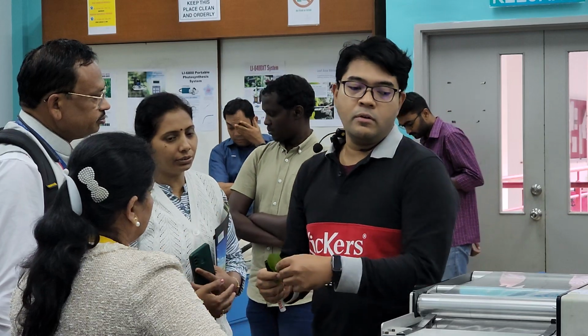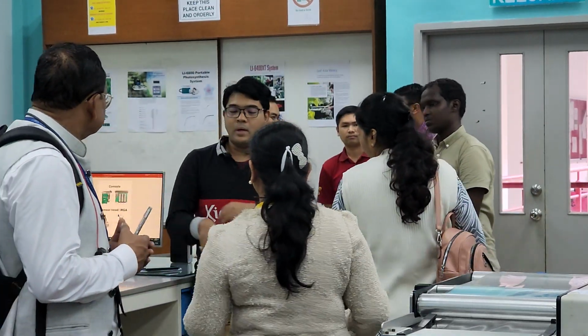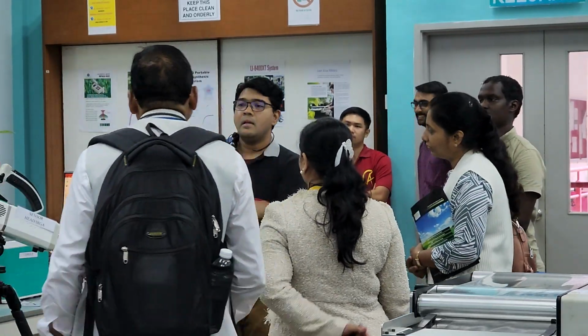In the newer version, they are detecting that yellow. There's a new version that actually detects the coloration and also the physical condition of the leaf. Today they have shown a demonstration like that. Of course, we are in the process of renewing our equipment as well, probably with a new budget from the government, so we'll get new equipment. Okay, I think that's all for this quick demonstration. Any questions?